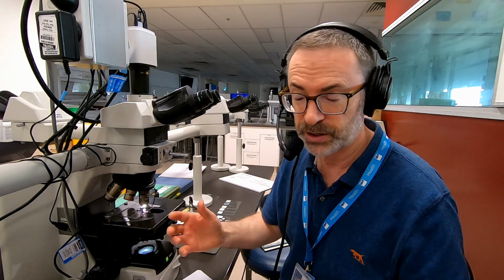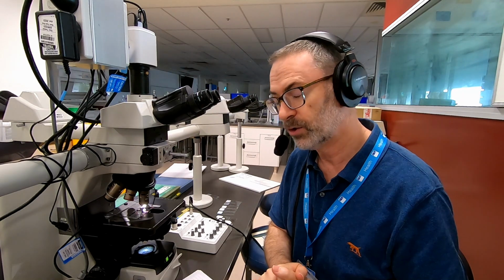So last week I introduced the concept of pigments and we broadly defined what they are, that being elements of color that we can already see are present within a tissue section independently of having applied any dyes or stains to the tissue.